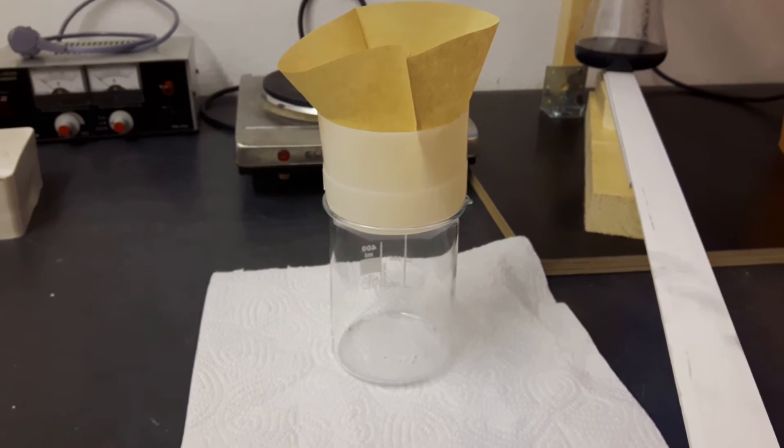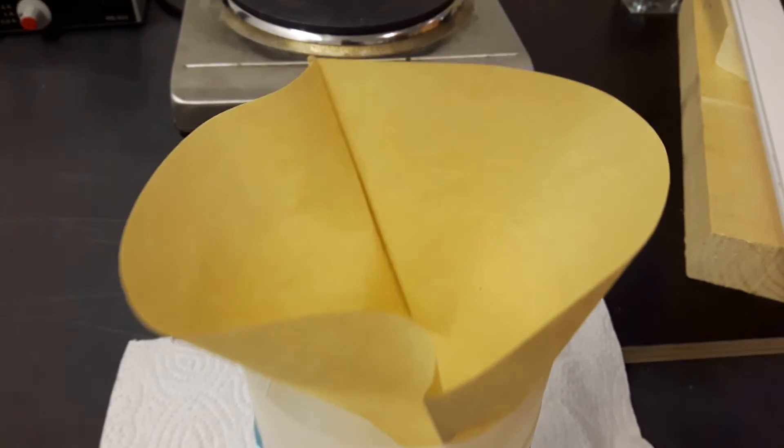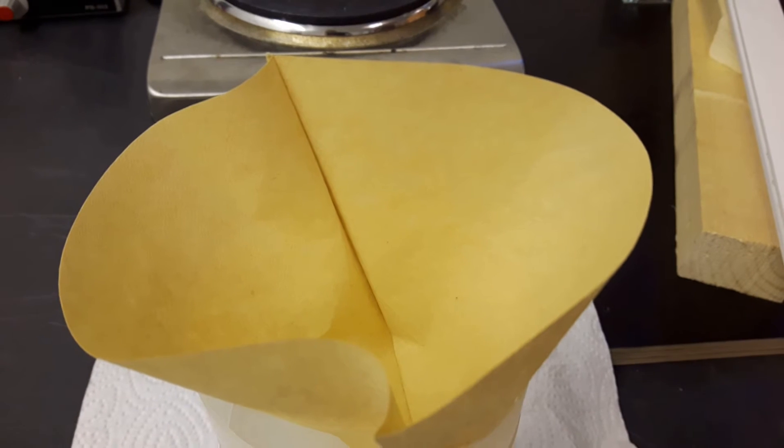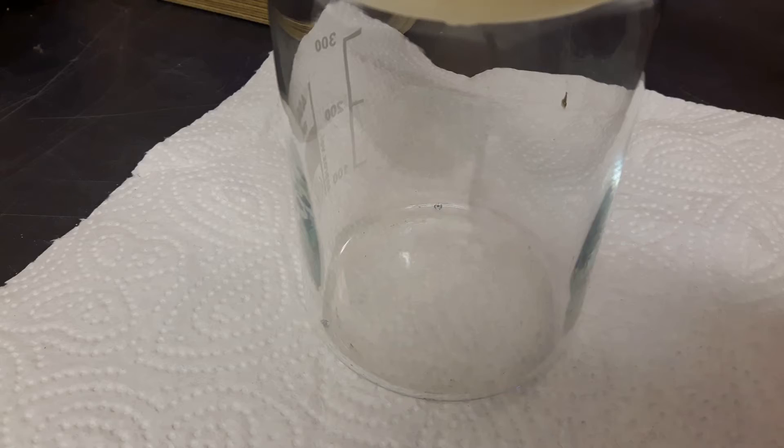And additionally I freed a lot of isopropoxide vapor. So here's my improvised filter device. Because all my funnels vanished. I don't know where they go. So one funnel I did throw away after a terrible stink. And the other funnels are simply not there anymore. So I improvised using a plastic bottle. And I drilled some holes in the bottom. And put a coffee filter on top. Which is really not a good filtering approach. But I have to deal with the things I have simply.